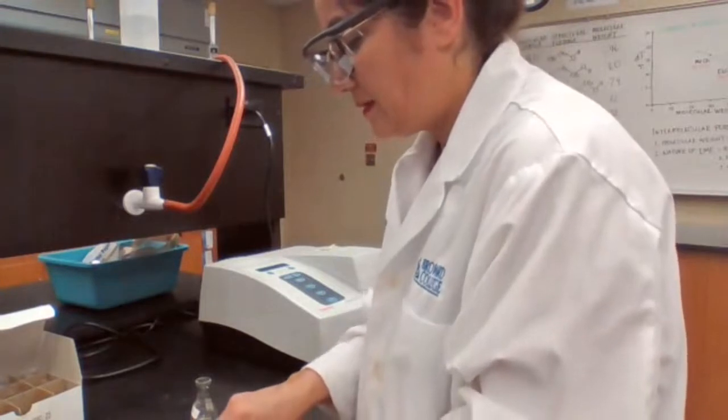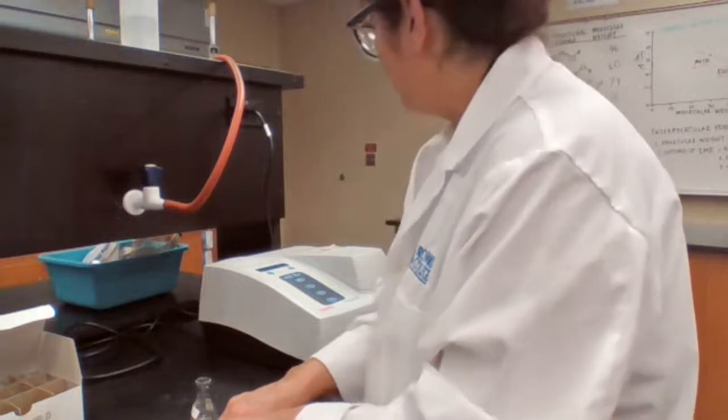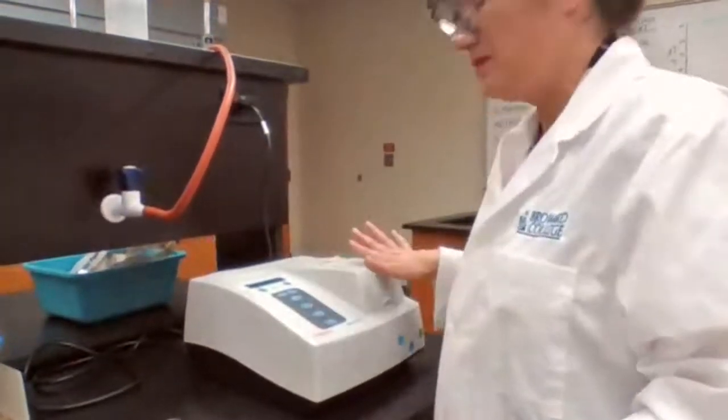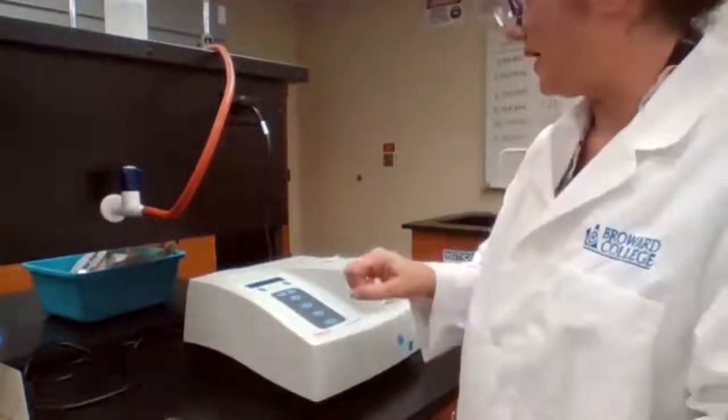Place it and press the 100%. So we are going to calibrate the machine with solution A because solution A had no KSCN.